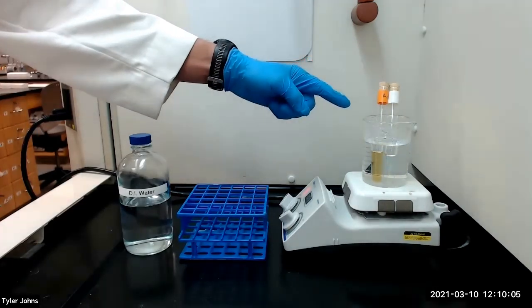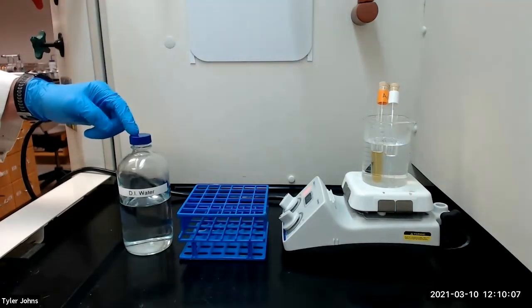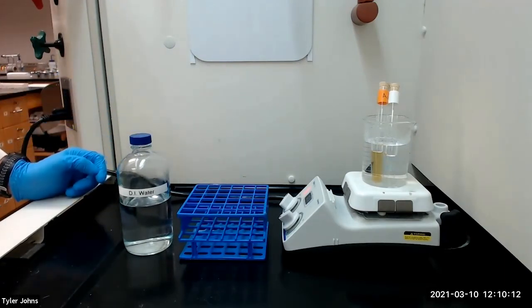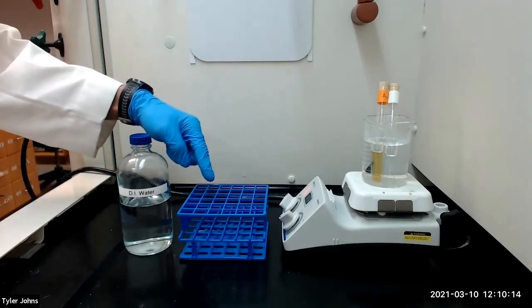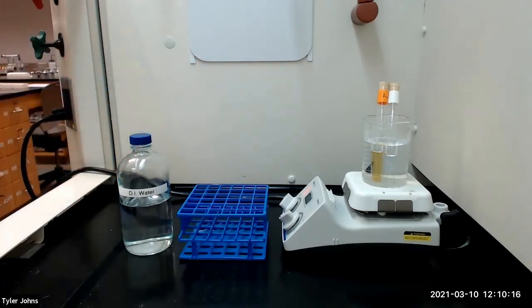After five minutes, we will next fill the test tubes with deionized water to within two centimeters of the top. We will then cork the test tubes, shake them vigorously, and allow the tubes to stand for 15 minutes at room temperature.